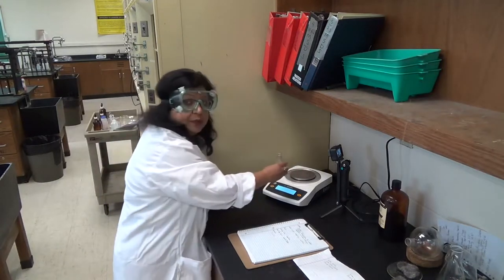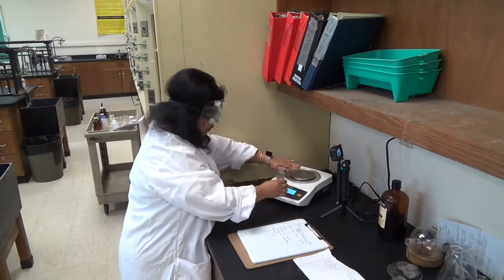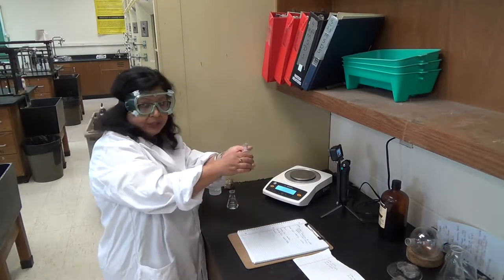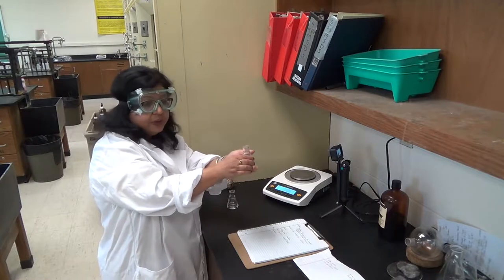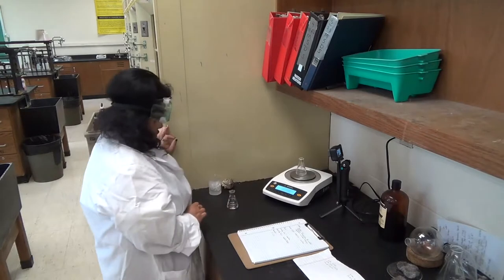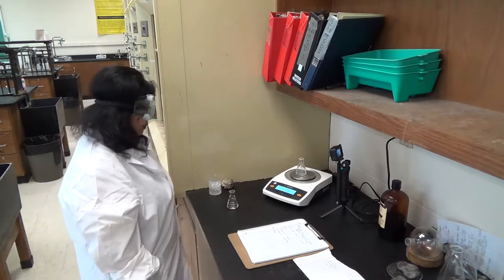So first, when you mass anything, make sure the top of this is very dry, and also make sure that the bottom of your flask or whatever you're trying to mass is dry. Put it over here and then wait for some time.